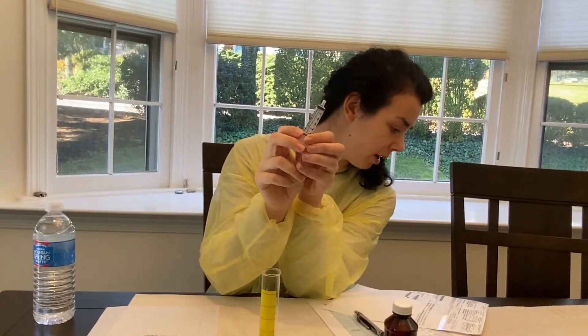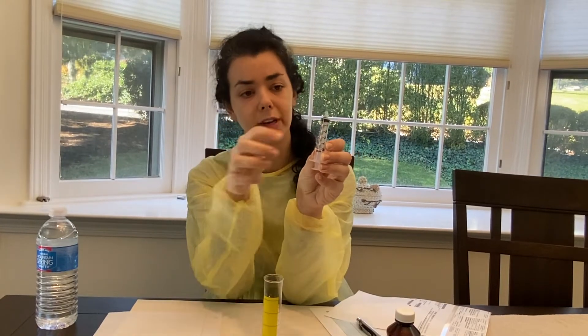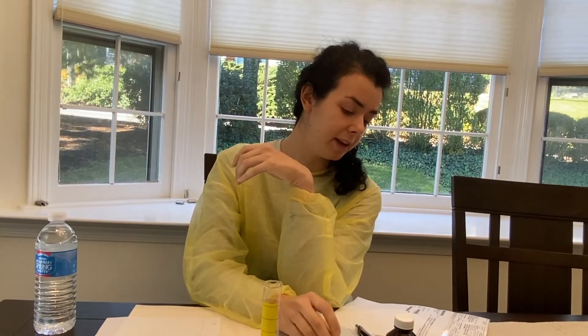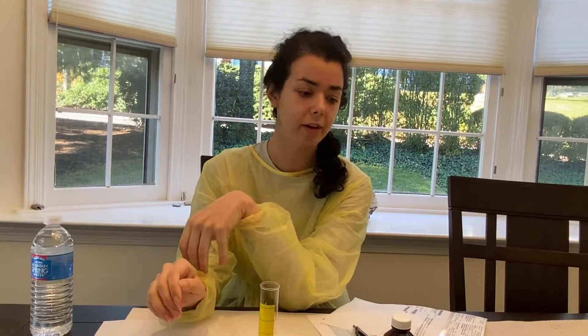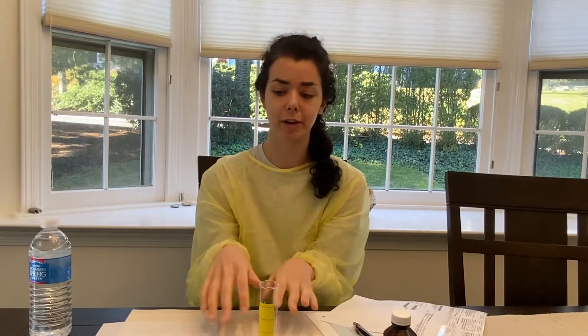After that, they would fill it up for the following four days to 3.75 milliliters. And if there's anything left over in the bottle, it would be discarded. Now I'm going to jump right into my proper handwashing, and then we're going to go and prepare this prescription for the patient.